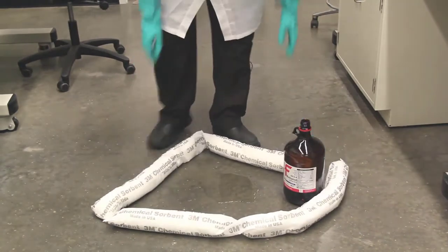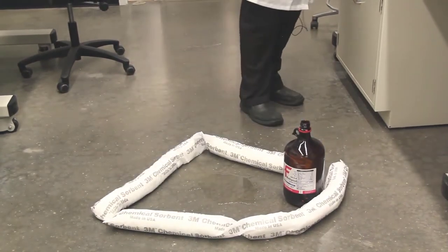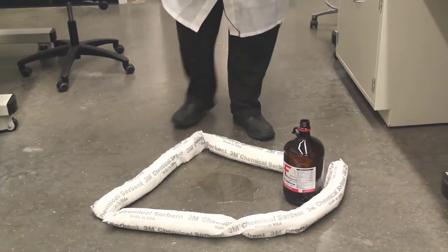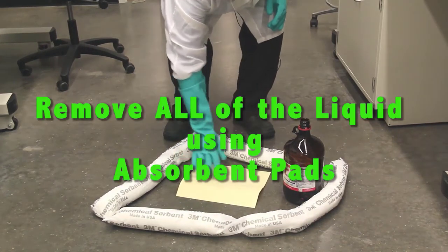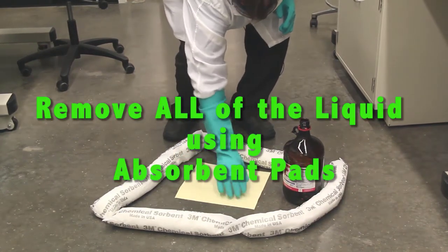Notice the spill is completely circled to keep it from spreading. Superabsorbent pads are used to pick up the liquid. Use as many pads as needed to completely soak up the liquid.